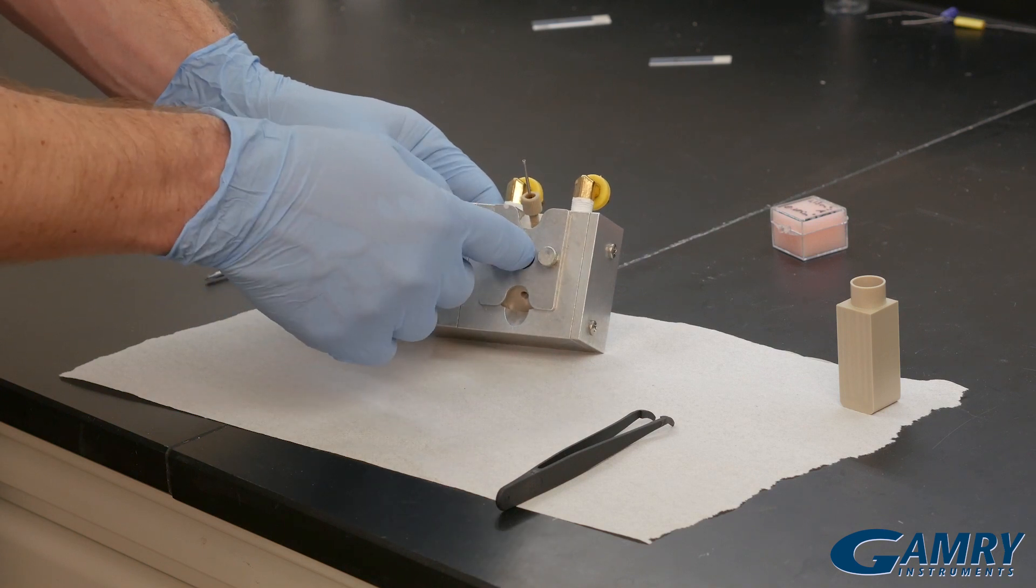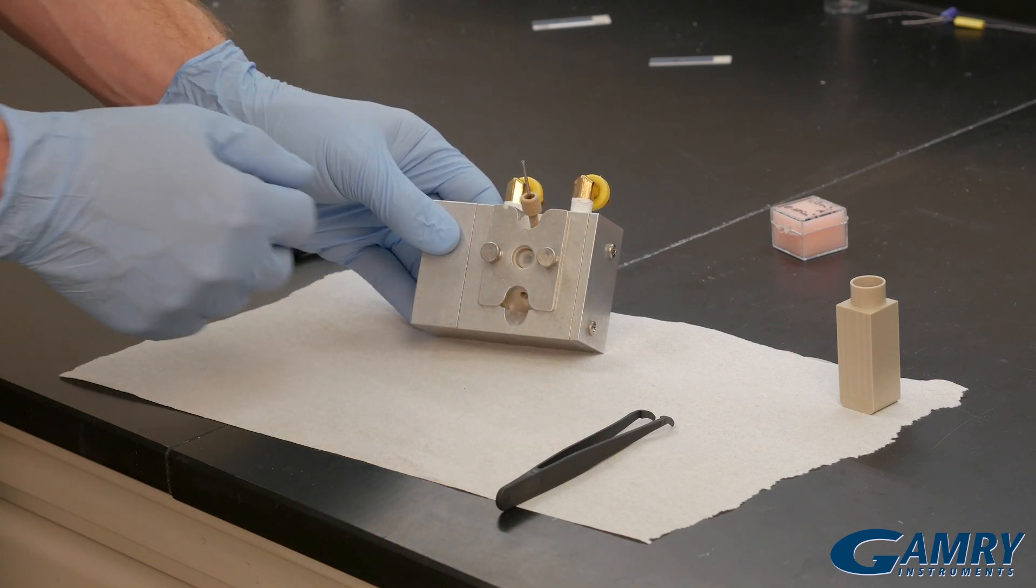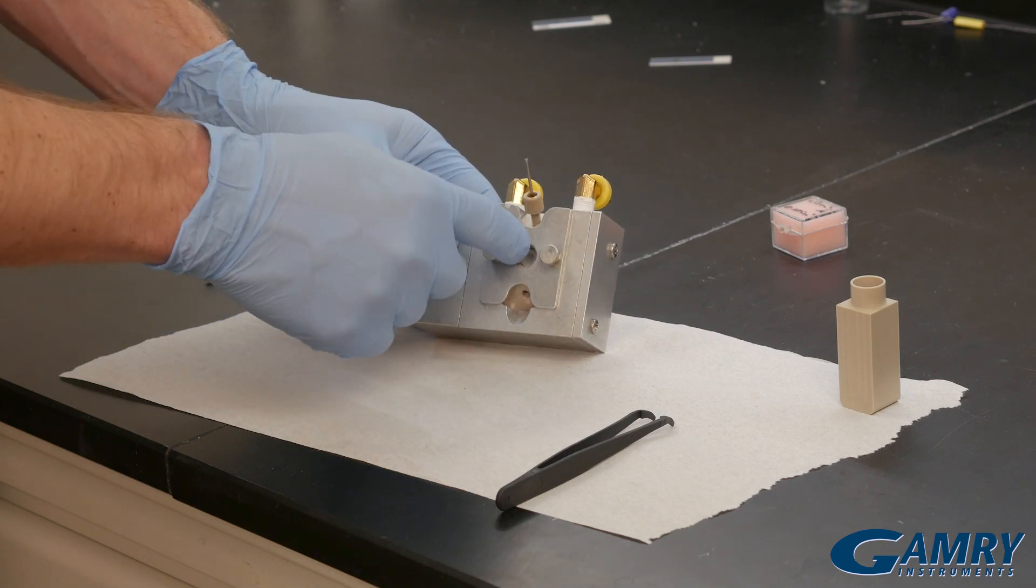This nylon screw in here will come out with a standard Allen key, and then we can screw in a reference electrode here.